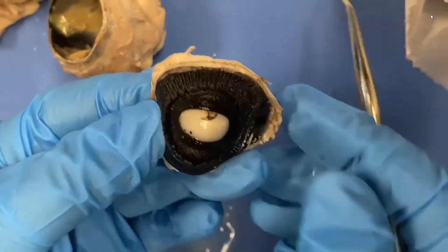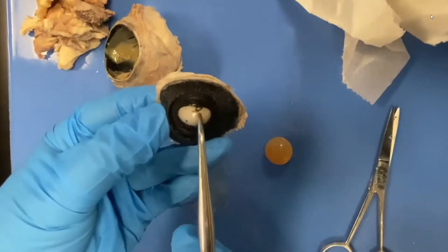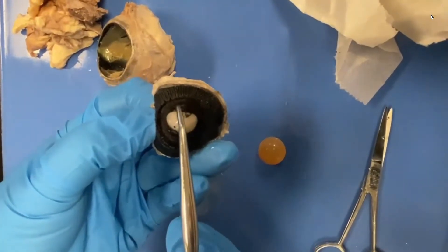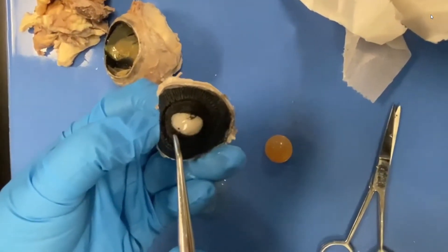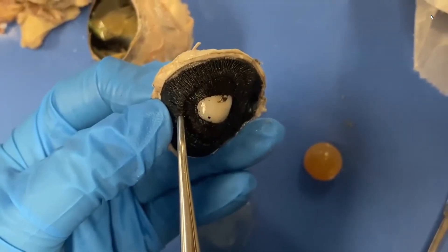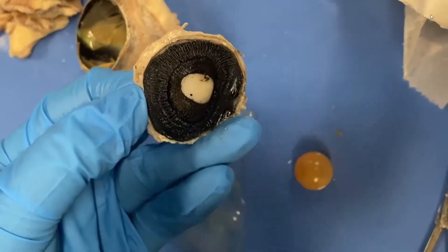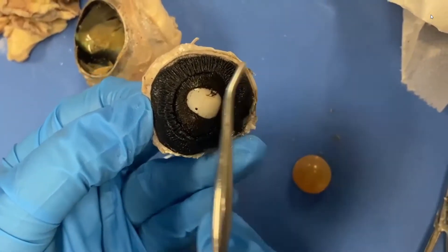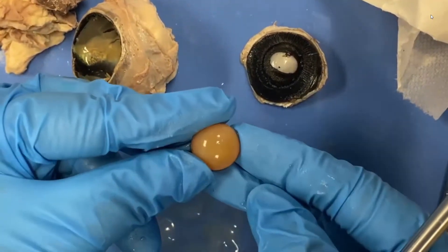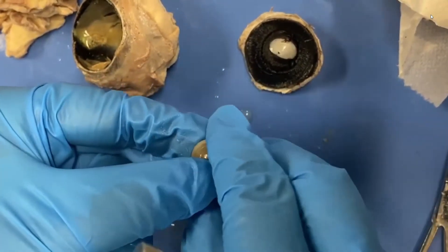So all this would have been in the anterior cavity. To look one more time: this hole would be called the pupil; the covering on the outside would be called the cornea; this internal muscle would be the pupil constrictor; the one on the outer part would be the pupil dilator; this muscle that connects to the lens would be the ciliary body; and then this little serratus structure at the end would be the ora serrata. And then there's a fluid in that cavity — you can tell me that too. Last is the lens, and there's actually a little bit of that suspensory ligament still attached to it.